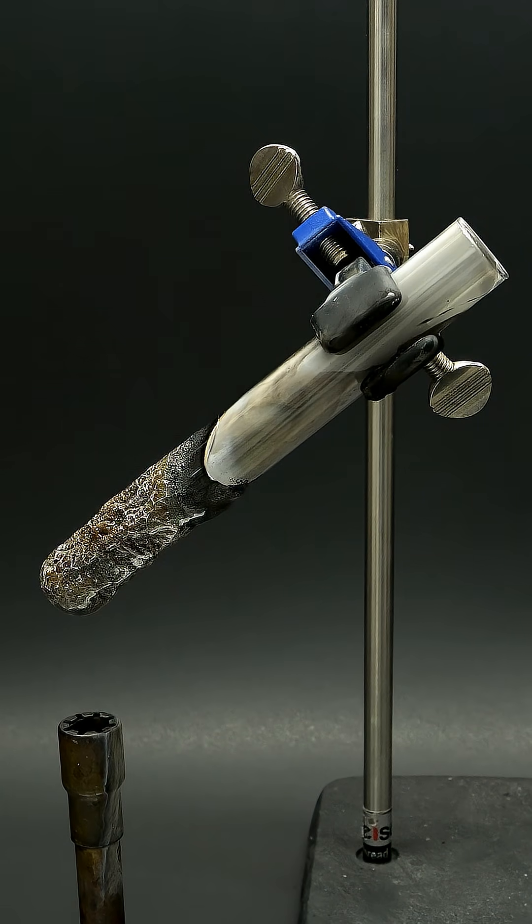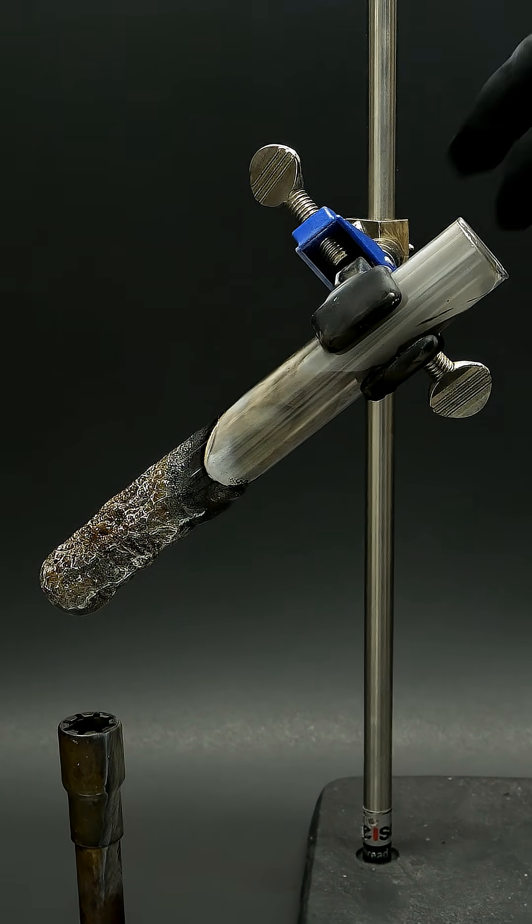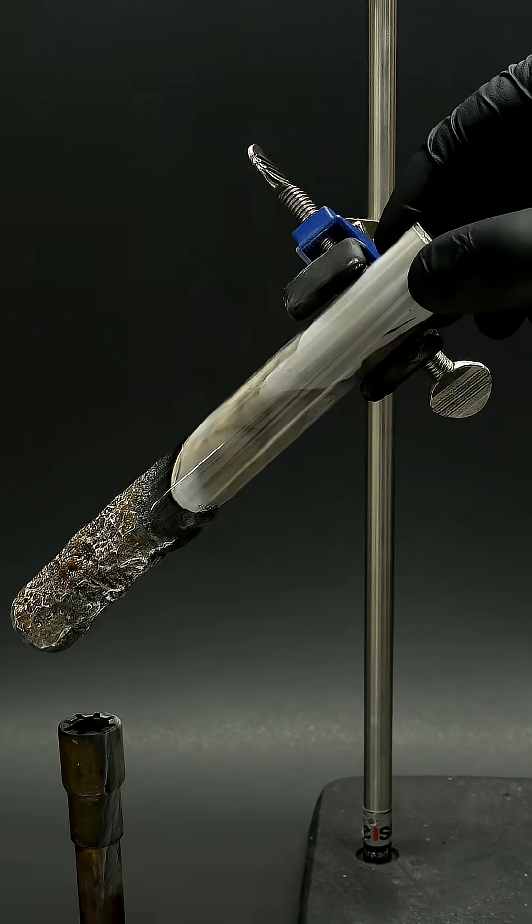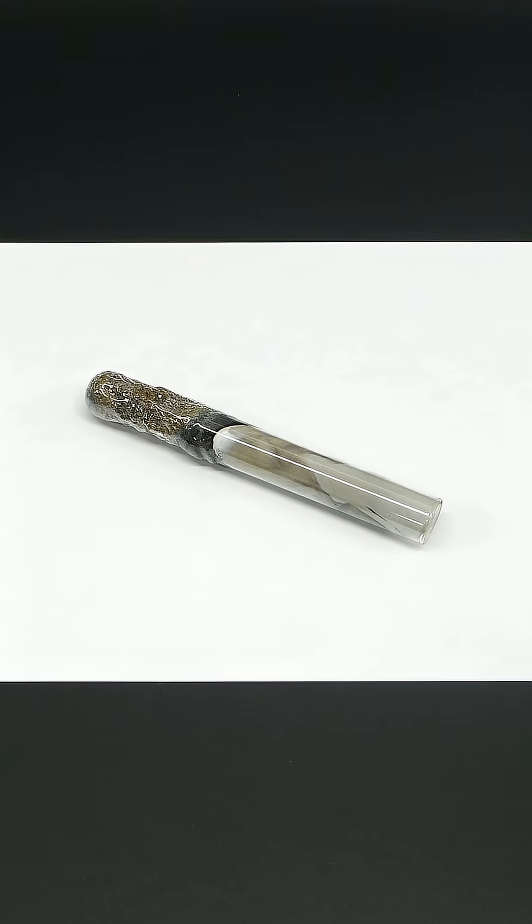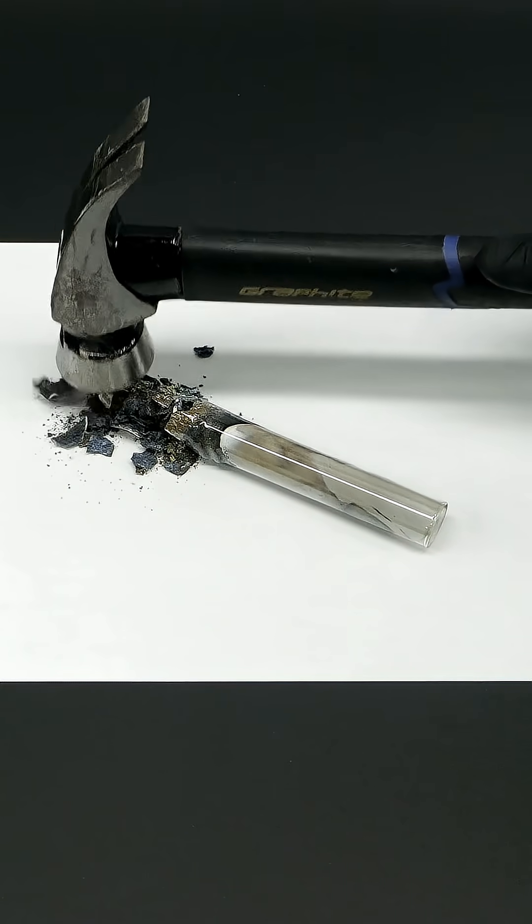But anyway, at this point the reaction is done. What I have to do next is take the tube off the stand, carefully place it onto a piece of paper, and gently tap it to break it apart.